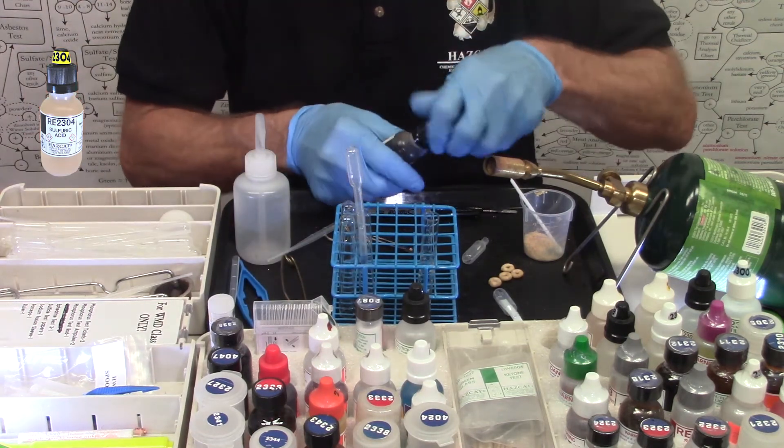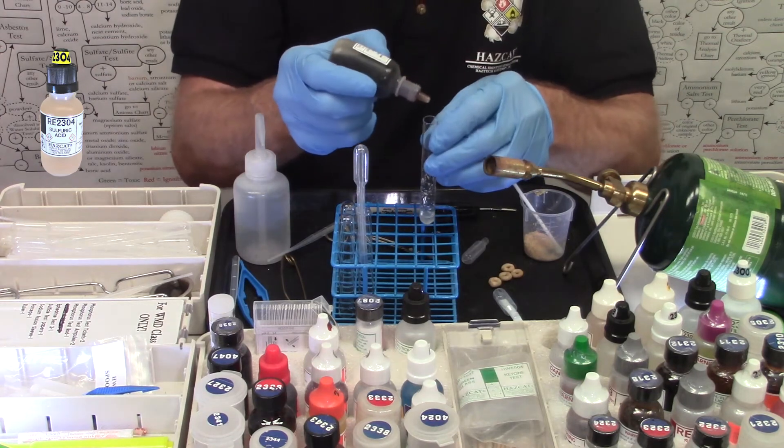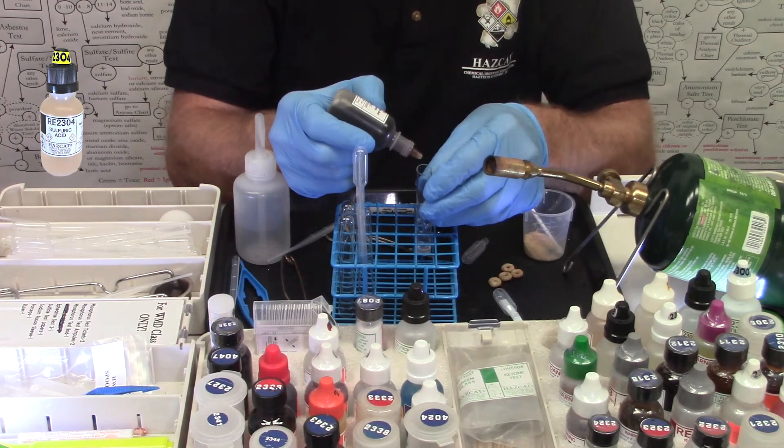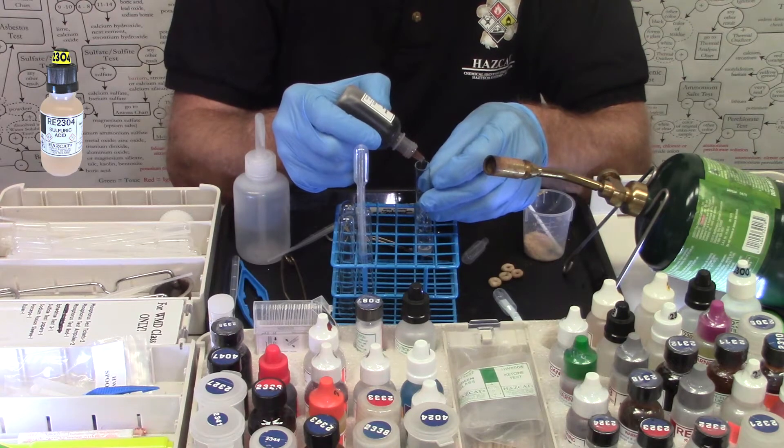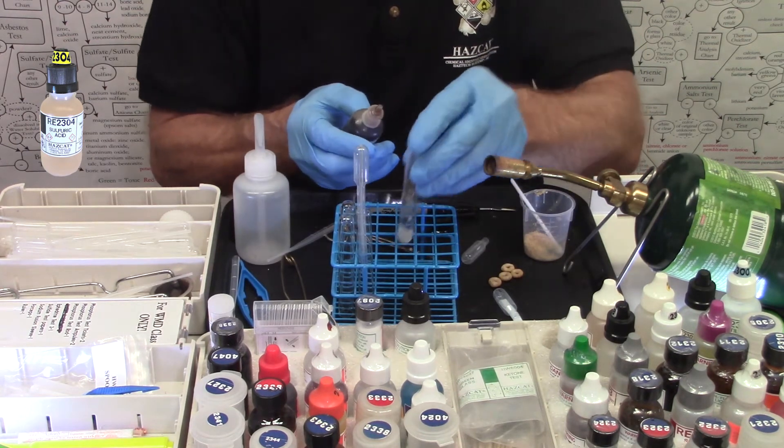Now I'm going to add six drops of the RE2304 sulfuric acid. This can be pretty hot. It's going to hiss. One, two, three, four, five, six. All right.